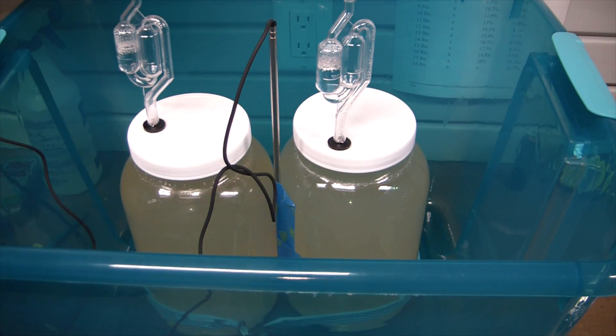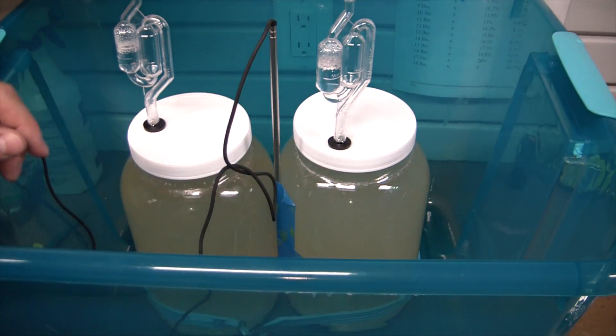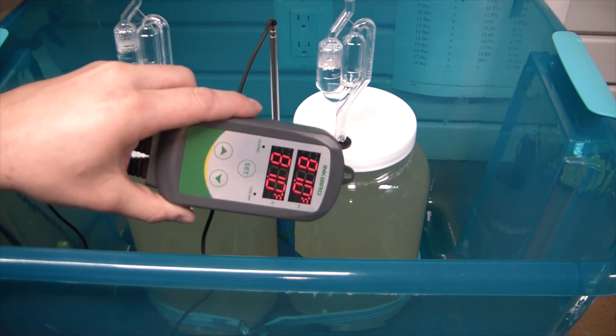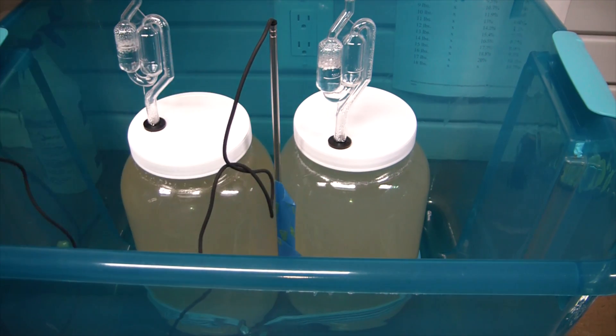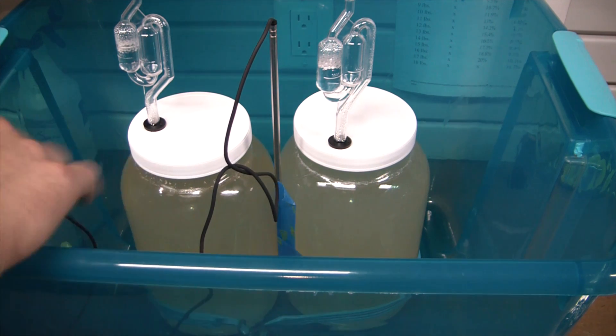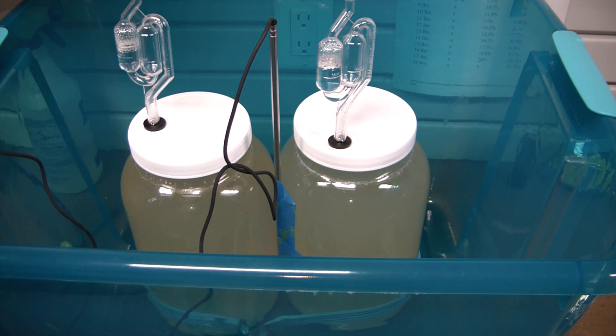So now that the yeast have finished up their good old routine of burping and farting, you can see I maintained them at a temperature of 81 throughout the fermentation. Should be around 20%. Let's move on to distillation at this point.